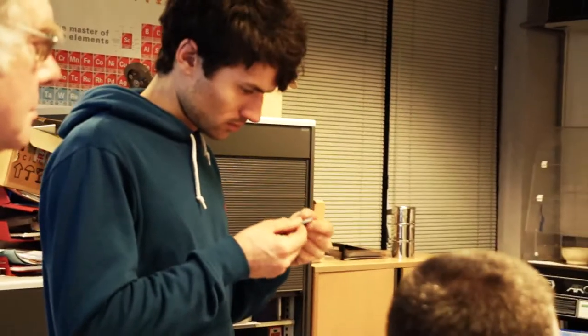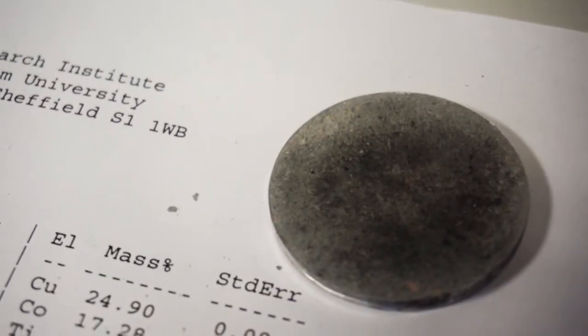What is in essence a small grey powder pressed disc. Then we can insert that in the machine and then we can do the measurements.